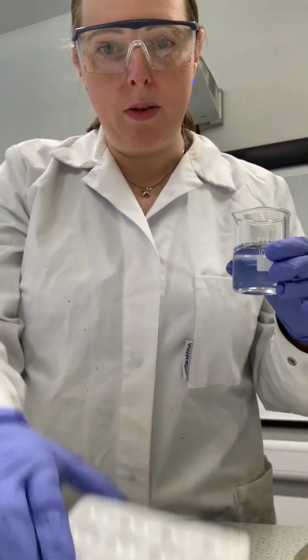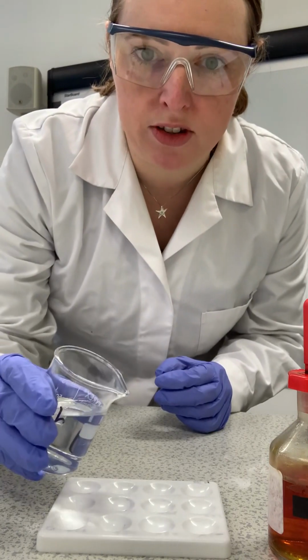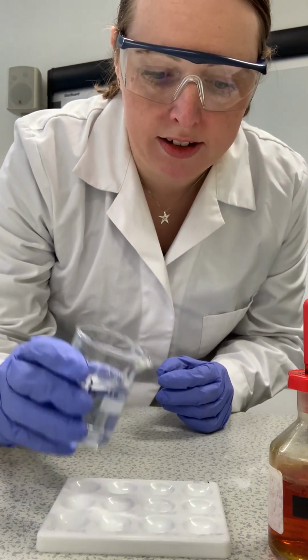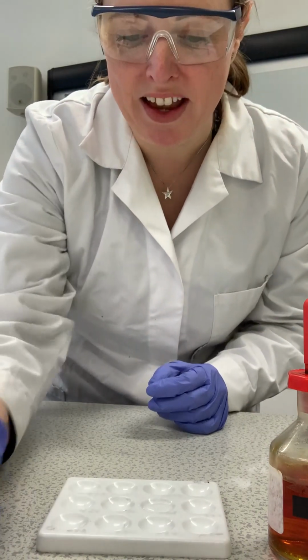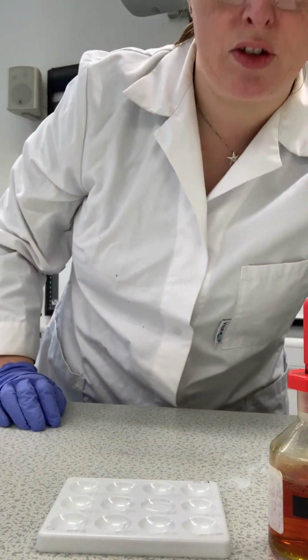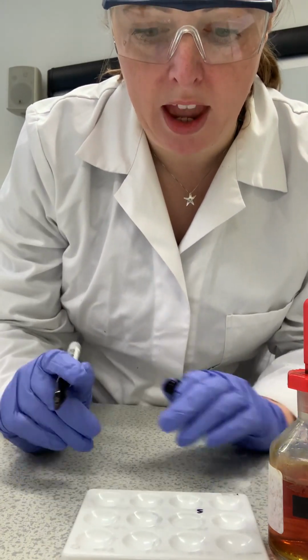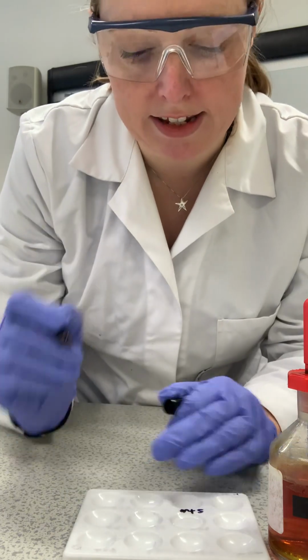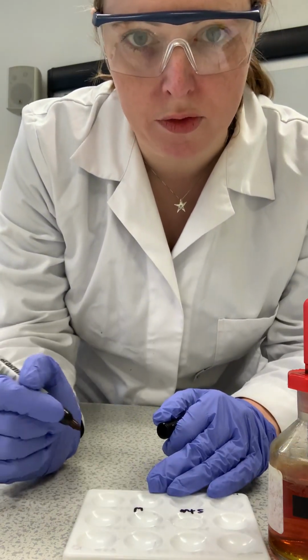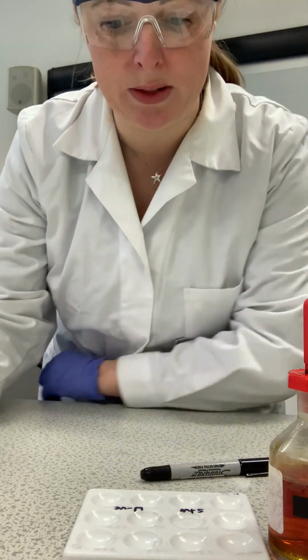So what I'm going to do in my drop-in tile, I'll just adjust my camera slightly. What I'm going to do in my drop-in tile is add in a small amount of the starch, that's the positive control. Always good as a scientist to label things as well. So I'm going to put S for starch there, and that should be positive. And our negative will be just water. So I'll do a W for water, and that should be negative. I'll take a picture of this and post it as well.